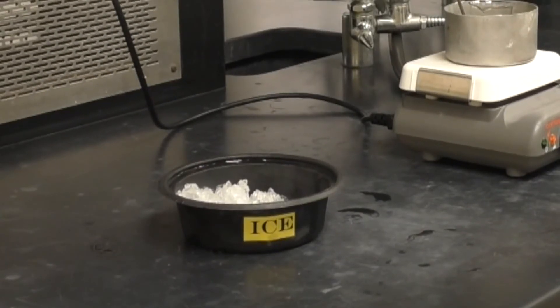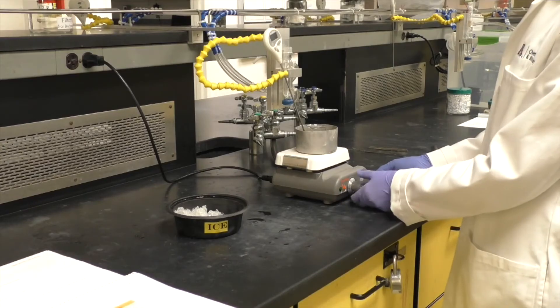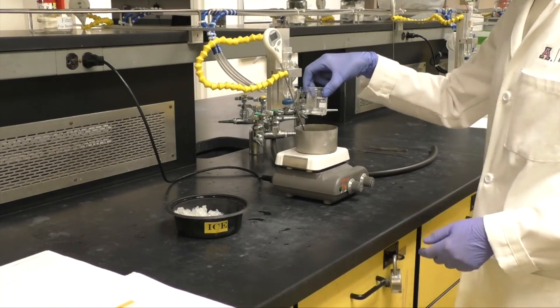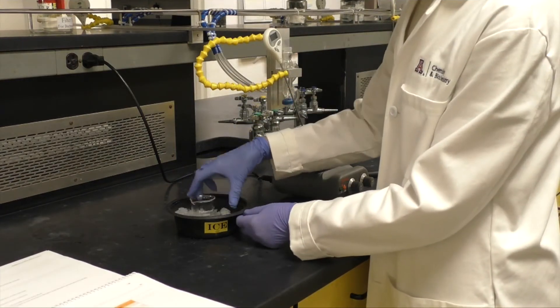While it is heating, prepare an ice bath. After 10 minutes, place the beaker in the ice bath and allow the crystals to form.